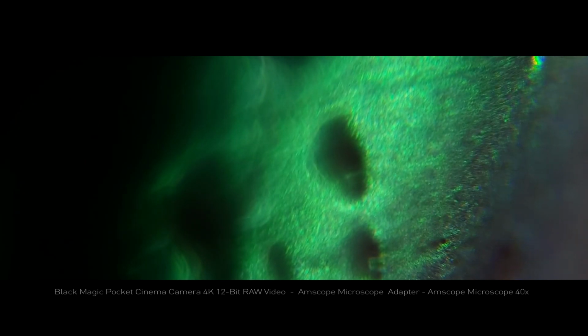Here I tried to record a bug with a green glowing shell and tried to use 10x to 40x lenses. Interestingly, focusing by changing the distance creates this weird psychedelic effect. It looks like a computer-generated animation, but all I'm doing here is changing the distance between my microscope lens and my object, really slowly.